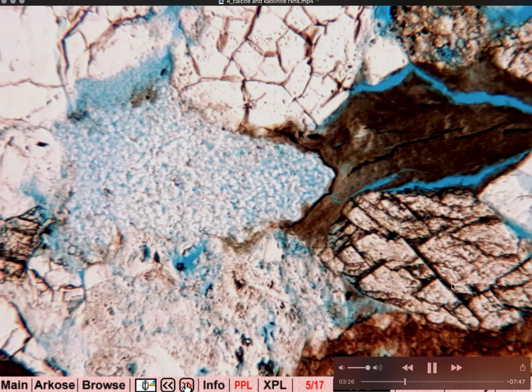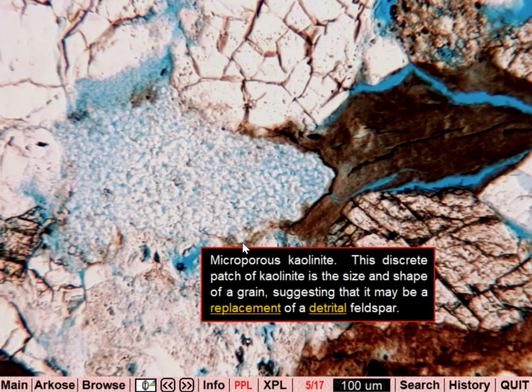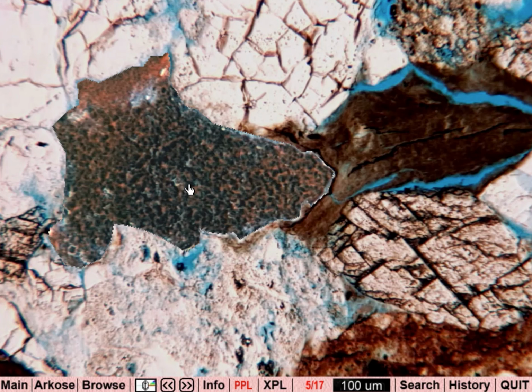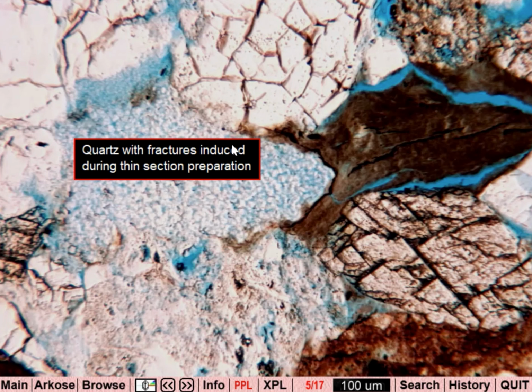All right, now we have a new mineral for the first time. We have a destroyed looking plagioclase feldspar, but now we have kaolinite for the first time. This is a secondary mineral. It's got a lot of porosity, microporosity here, so it has this mottled texture, a very low relief, indistinct outlines compared to the quartz.